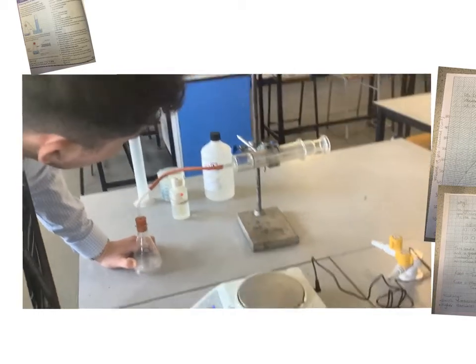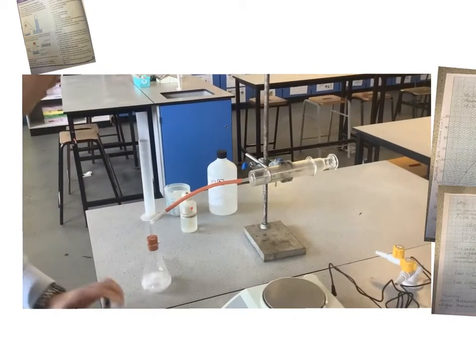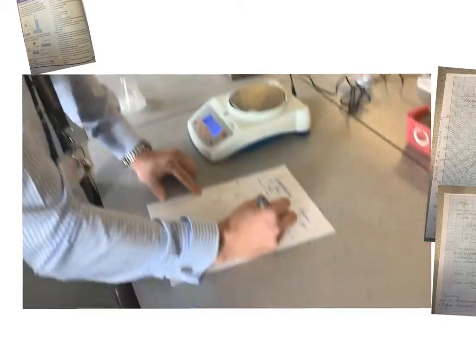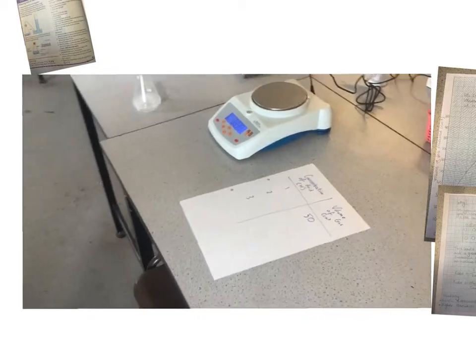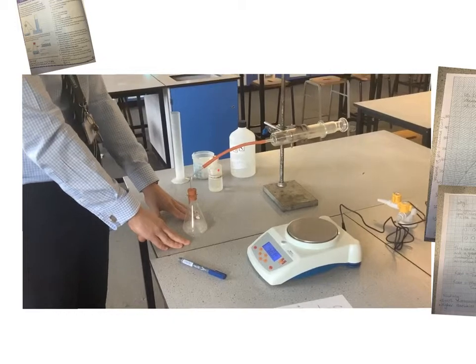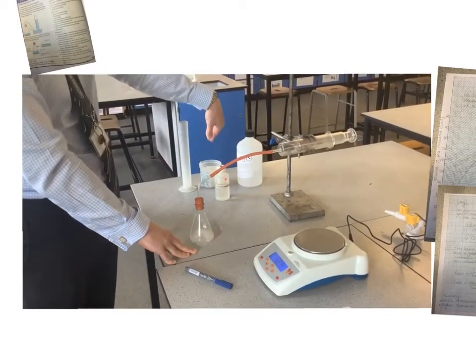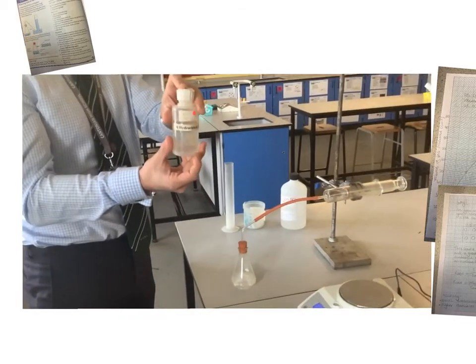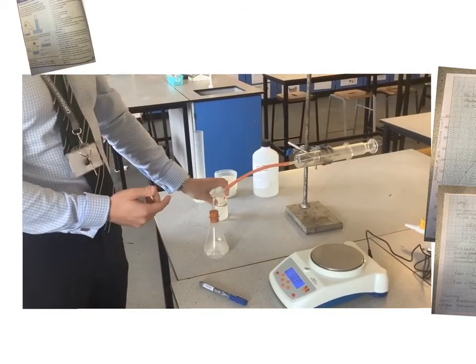Right, what are you going to do once it's done then? So once it's done, because we can see now the volume of gas, I'm just going to say that I've recorded it, it would be 50 centimetres cubed. I'm going to wait for the reaction to finish, and then I'm going to start all over again. I'm going to wash my conical flask out just to make sure there's no acid or marble chips in there. I'm going to measure out 5 grams again of my marble chips, and then repeat at 2 molar hydrochloric acid and 3 molar, and then I'm just going to compare.